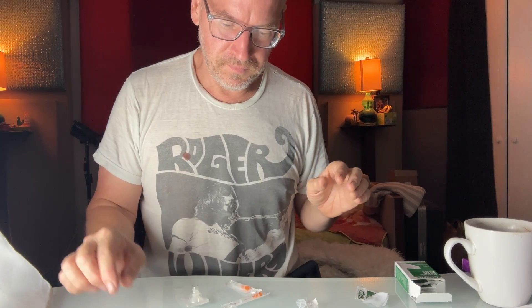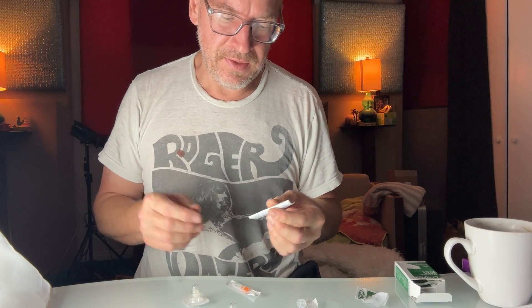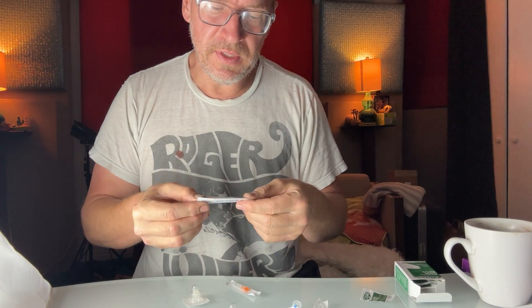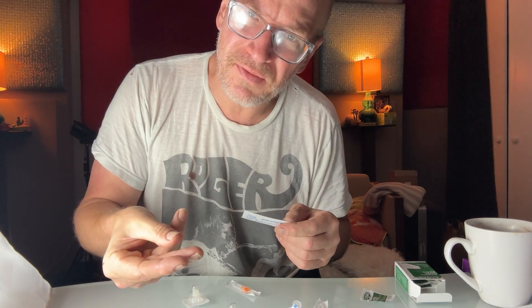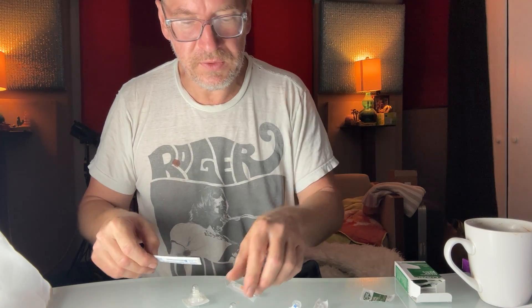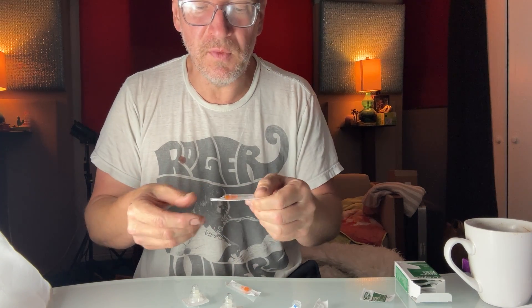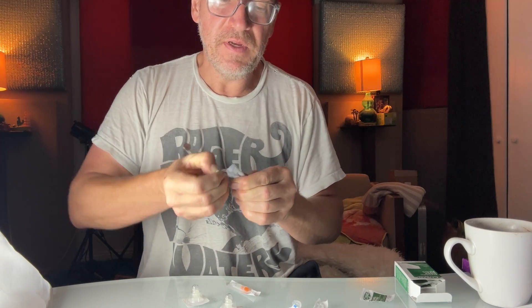We're going to reuse this needle because we're going to extract the peptide out of there and it's going to go into a second vial. So now let's prep our destination vial. We're going to wipe it again. The thing to do with this — it's sealed, right? So if we're trying to inject the fluid in there, it's going to fight us. So we're going to put a vent filter on there. We have a filter and a small needle, and the short needle just needs a poke inside.